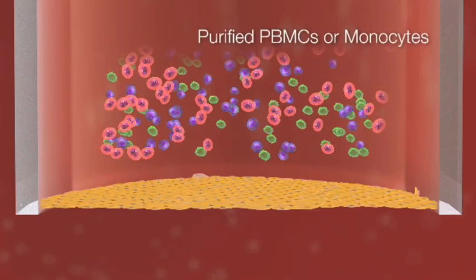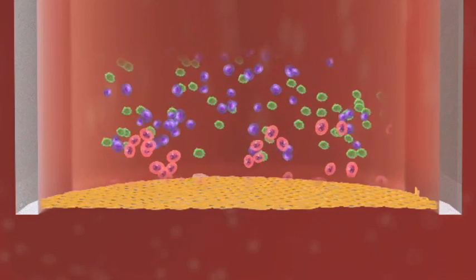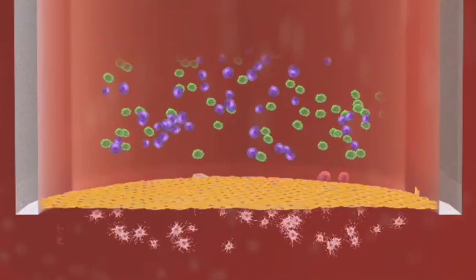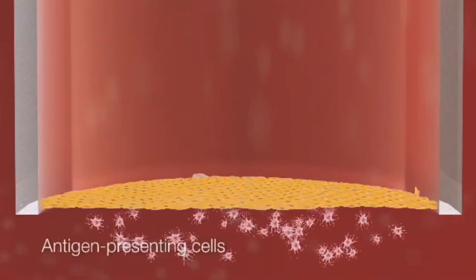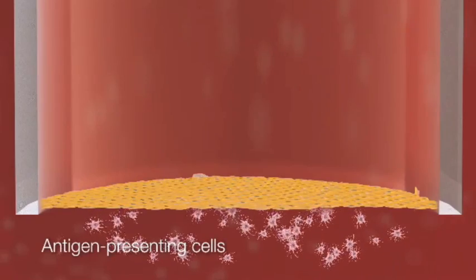The monocytes selectively migrate through the endothelium, and excess cells are washed off after an hour. After migration, they spontaneously differentiate into subsets of antigen-presenting cells with a range of phenotypes, such as dendritic cells or macrophages. The dendritic cells reverse transmigrate through the endothelium, mimicking traffic across the lymphatics.